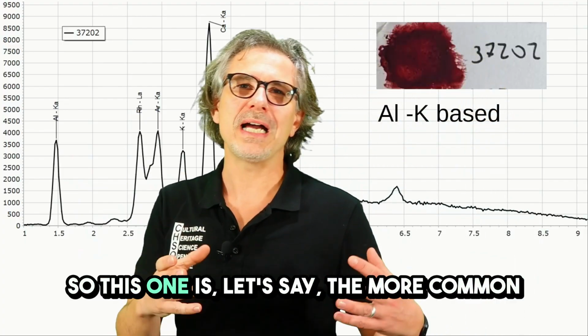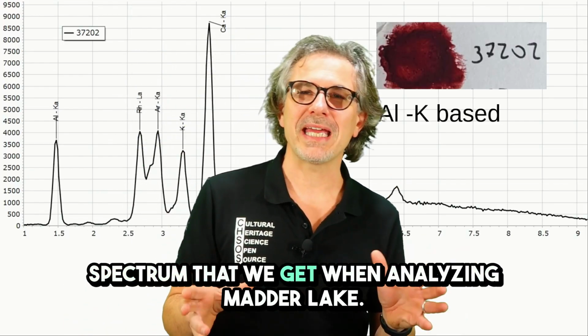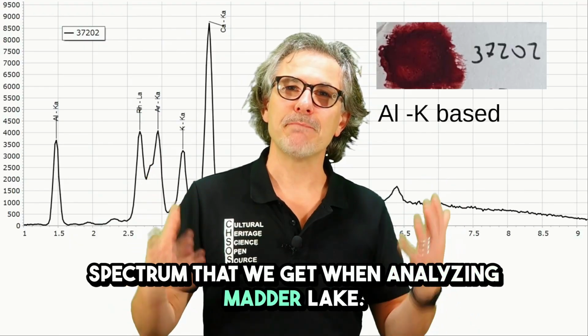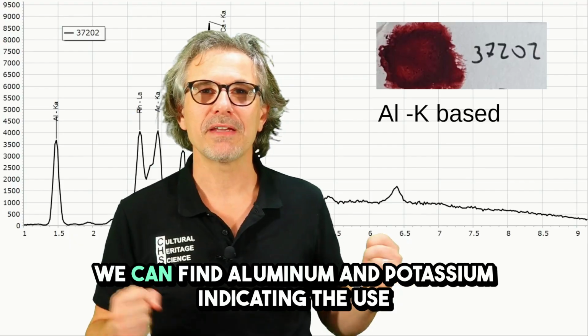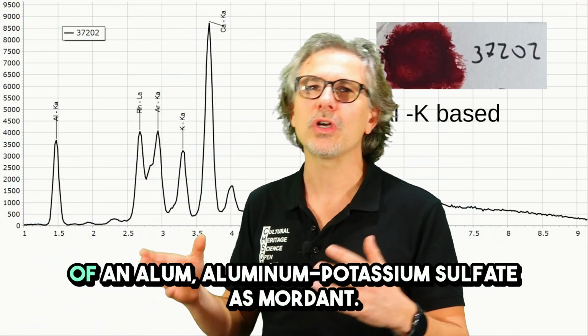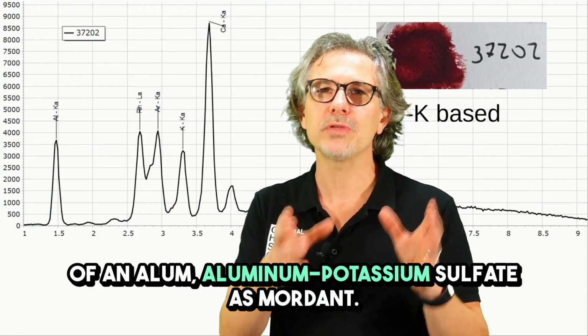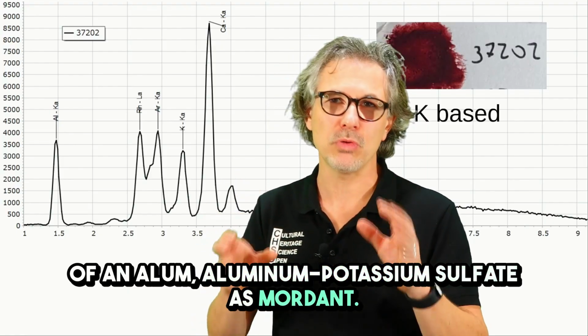So this one is, let's say, the more common spectrum that we get when analyzing Madder Lake. We can find aluminum and potassium, indicating the use of alum, potassium aluminum sulfate, as mordant.